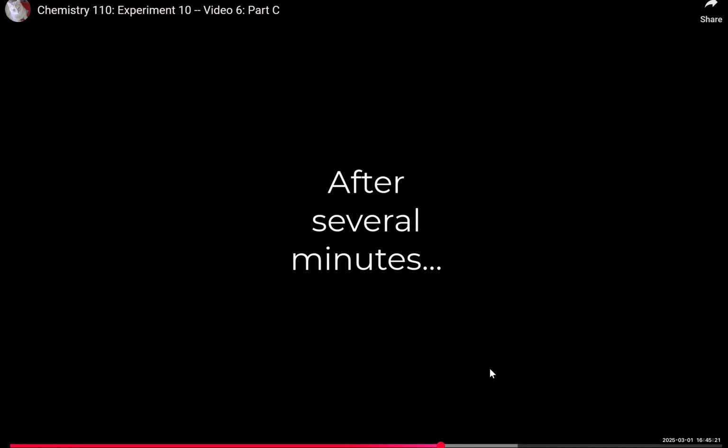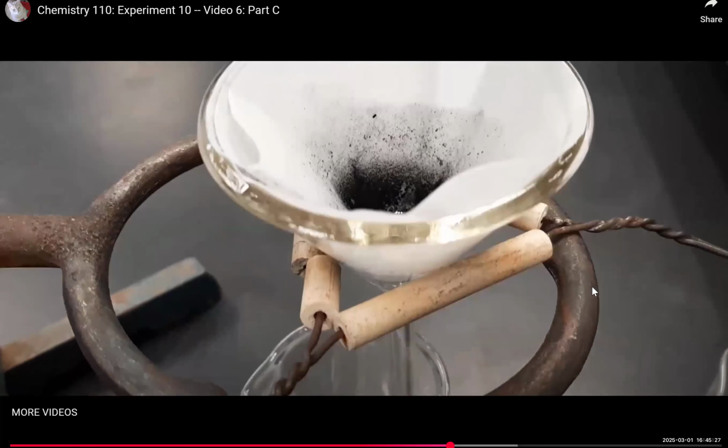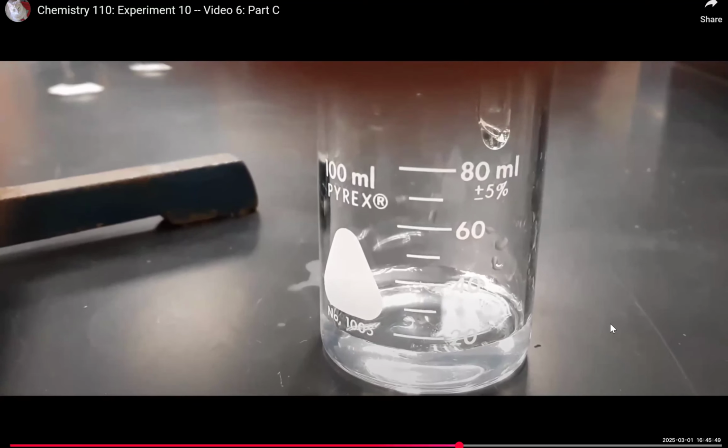Okay, so after several minutes have passed, we now have the filtrate liquid, which can be tested. After several more minutes, as you can see, the majority of the charcoal has been trapped on top of our filter, while most of the liquid has passed through the filter paper and ended up in the receiving beaker. This would indicate that the charcoal is likely a suspension. It's not soluble in water. Okay, that filtrate liquid that we've obtained, we're now going to be testing.